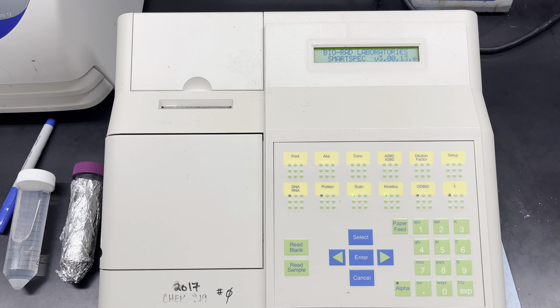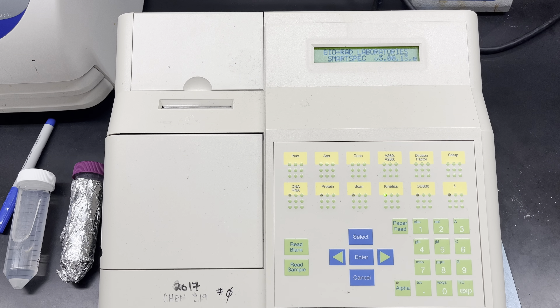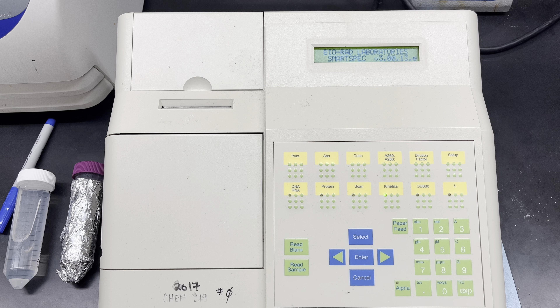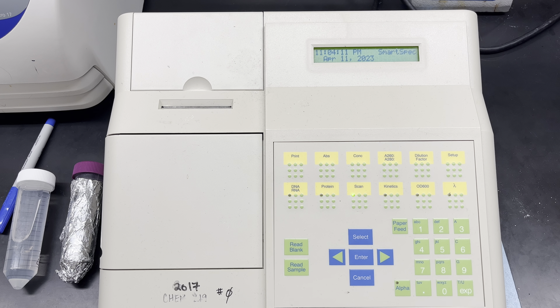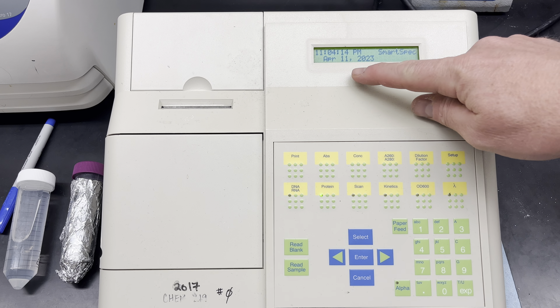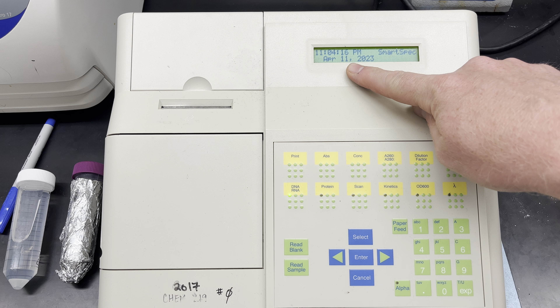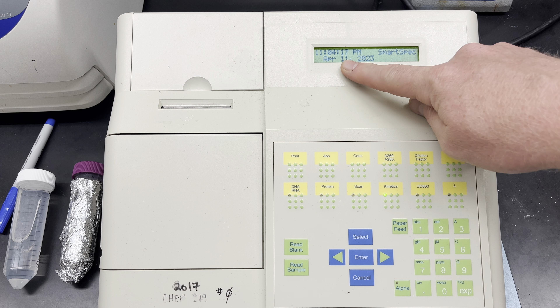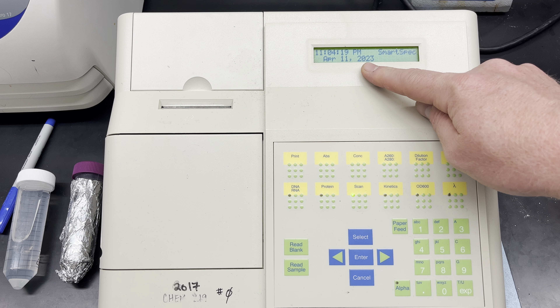I've just turned the instrument on and it's going through its regular calibration steps. Once I've reached this screen where it reads out a time — accurate or inaccurate — and a date, which is totally inaccurate, I'm ready to proceed.